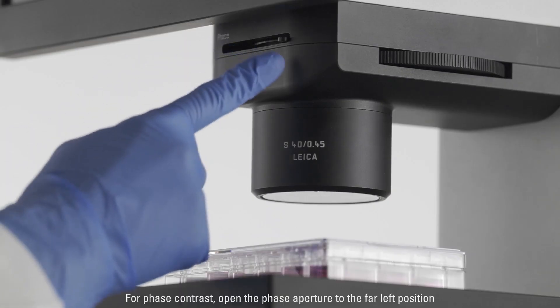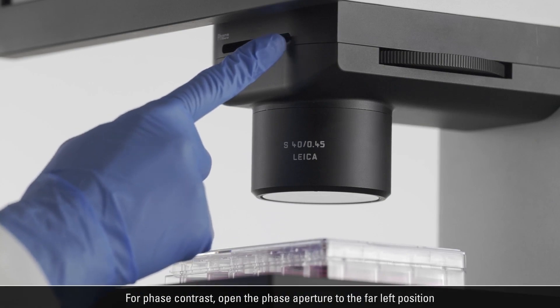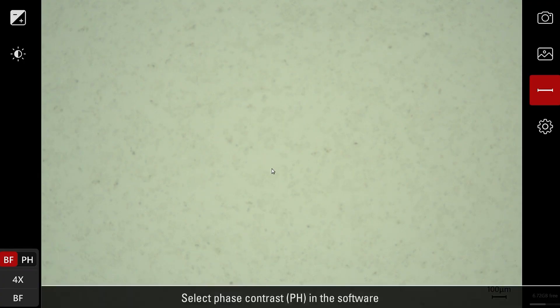For phase contrast, open the phase aperture to the far left position. Select phase contrast in the software.